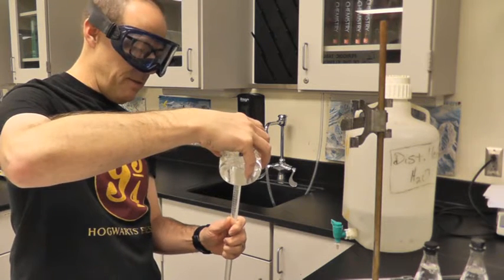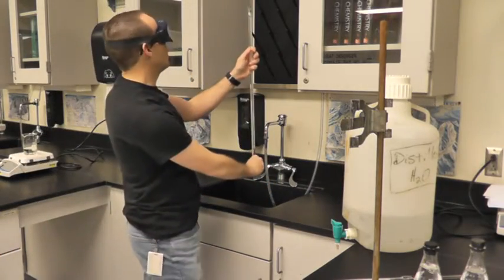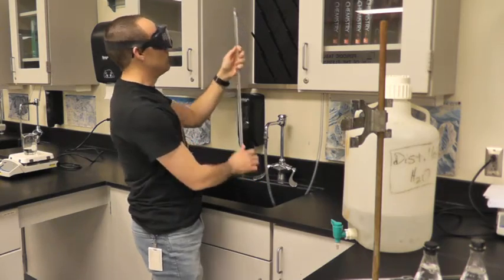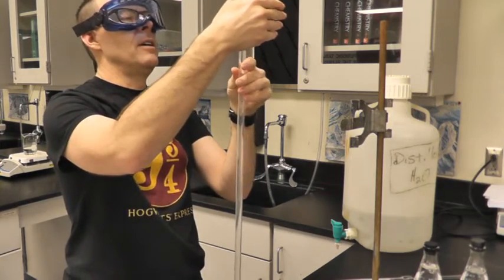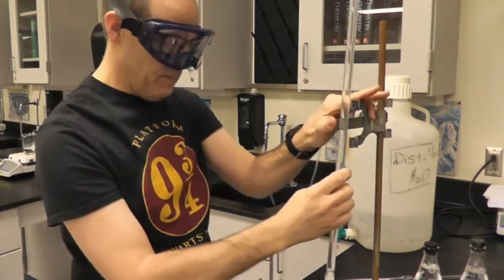All right, so anyways, I'm going to fill it past the 0 mark. Put it over the sink. Make sure all my bubbles are out of my tip. It's below the 0 mark. And then I'm going to write down my volume. All right, so I don't know, 0.043, something like that. Okay, so it's right at the top.